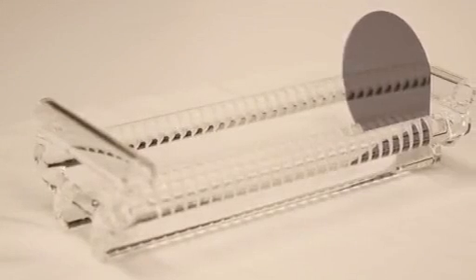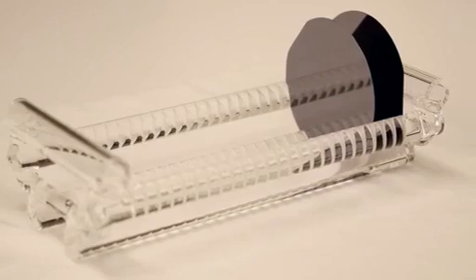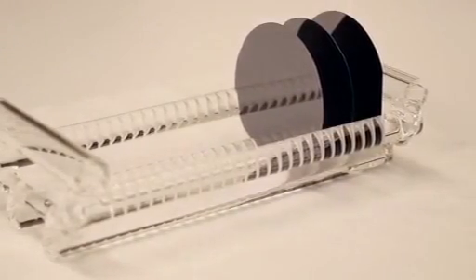First, place several silicon wafers into a quartz carrier for plasma cleaning. This ensures a clean hydrophilic surface that is essential for self-assembly of the polymeric nanospheres.